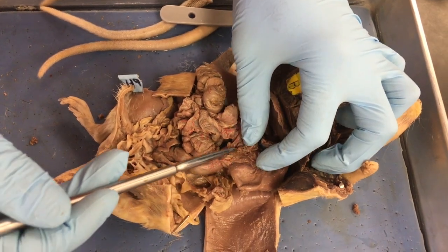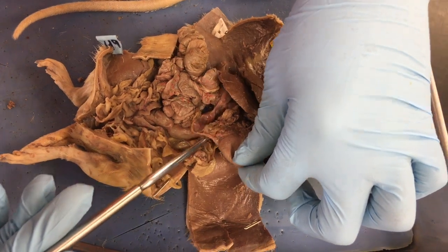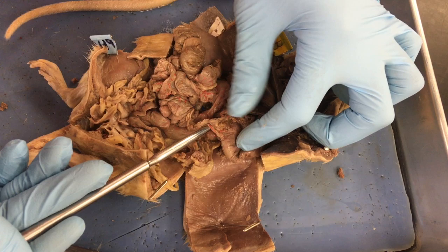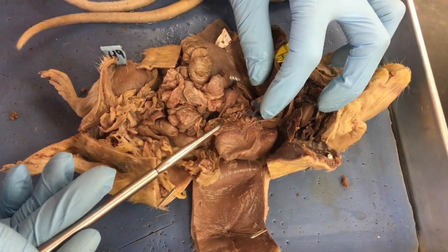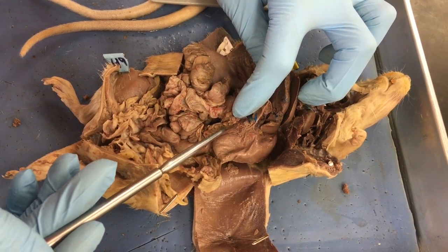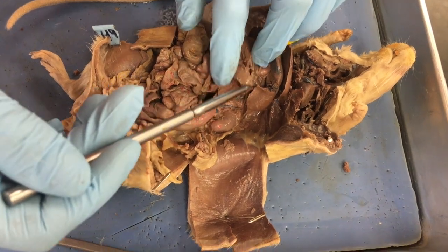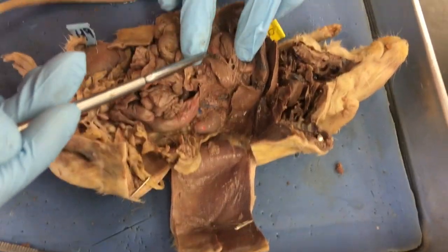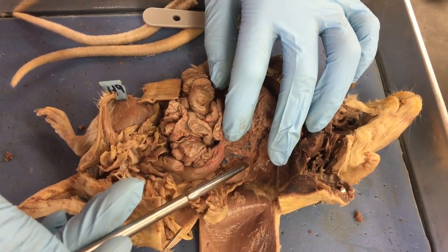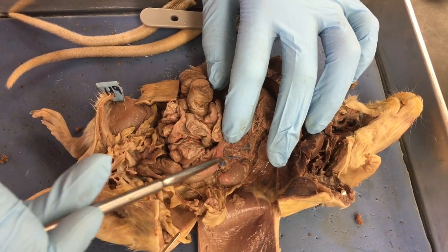And then all of this kind of gooiness that happens on the bottom right here, it doesn't look like much is going on there. That's pancreas. An easy way to determine what the pancreas is: find the stomach, and the goo that's attached to the bottom of it, that's going to be the pancreas. As I lift my stomach out of the way, this crescent-shaped organ back here, that's the spleen. Back here we have a kidney, and on top of it, this guy that I'm pushing up, that's the adrenal gland. So kidney, adrenal gland.